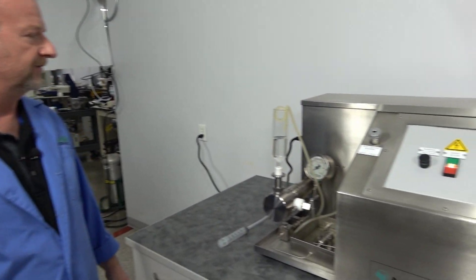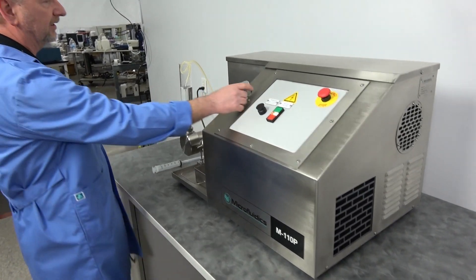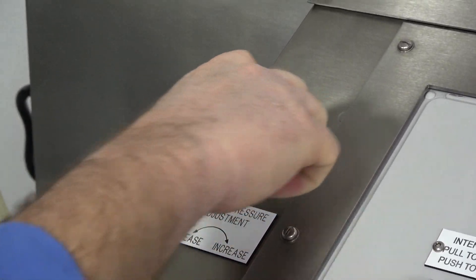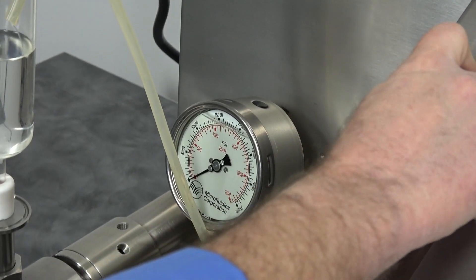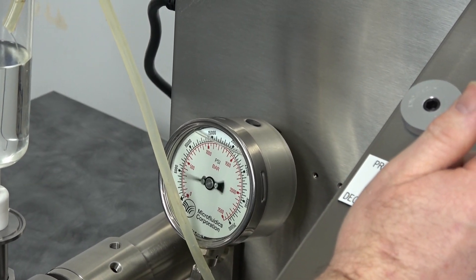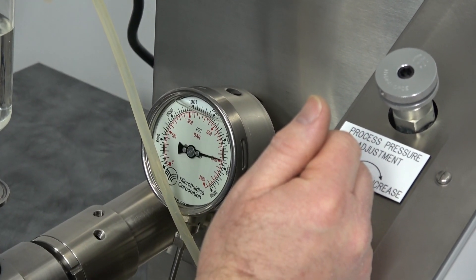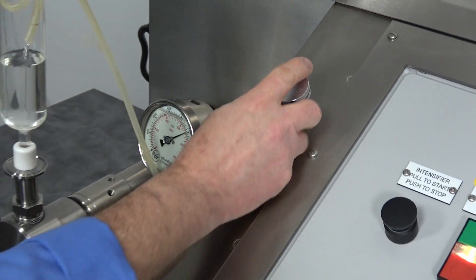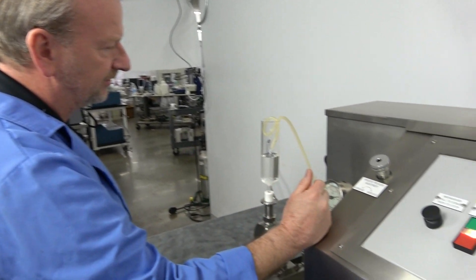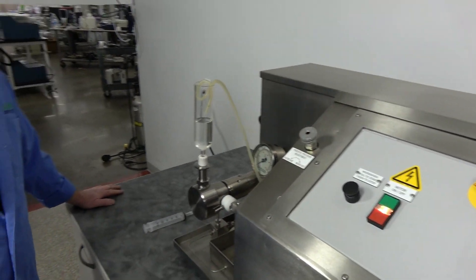That's as simple as it gets — it's just a beautiful machine that runs nice and smooth, very consistently hitting the 30,000 PSI mark. Up here is the pressure adjustment knob. When I turn this knob down and you watch the gauge, you're going to notice the stroke pressure just gets less and less — now we're running only about 25,000 PSI. It's just that simple: you adjust it to where you need the pressure. When you've got a 75 micron mixing chamber, you need to stay up in the higher pressures to drive it through, depending on what you're mixing.